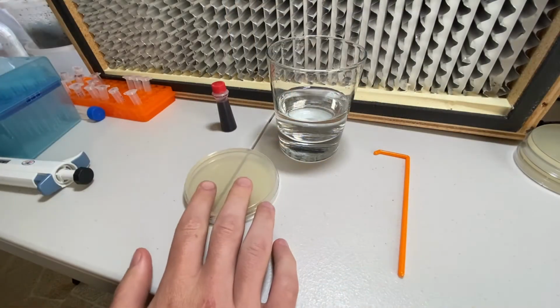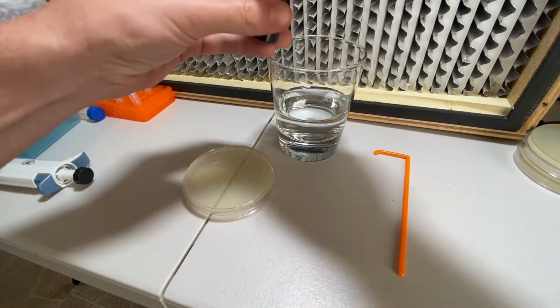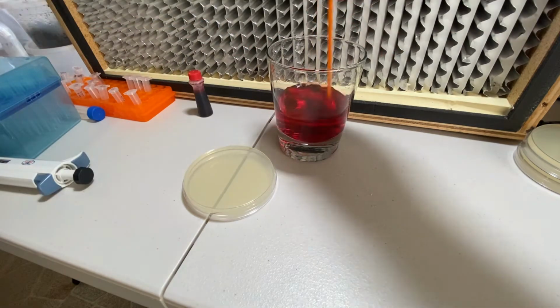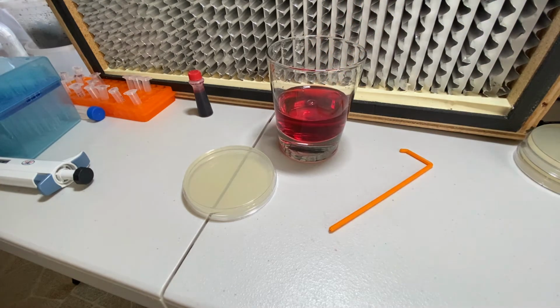Okay, now to test my plate spreading technique, what I'm going to do is take some red food coloring and add it to this little bit of water that I have. This is just regular water. Give this a little stir. I don't know if this is going to work, and I never have seen anyone do this before. So this will be kind of an interesting experiment.